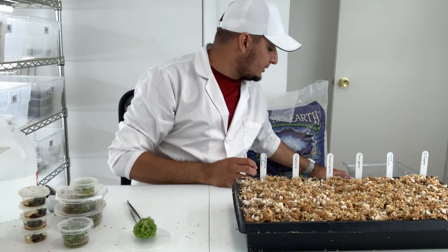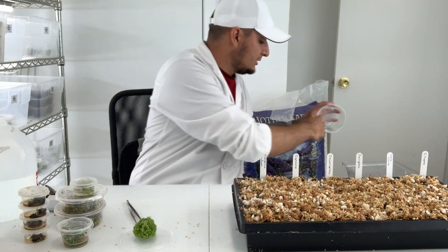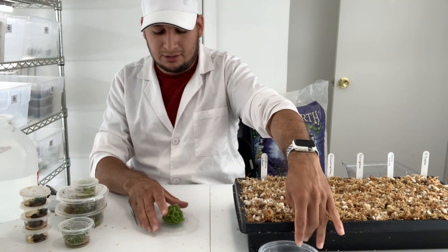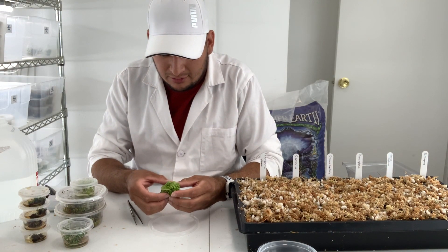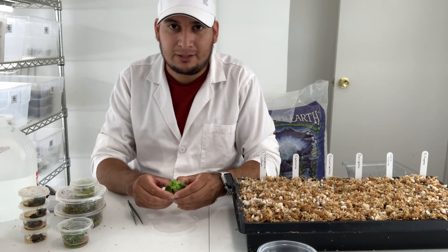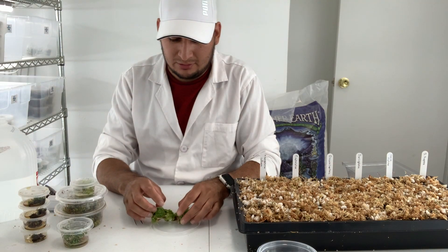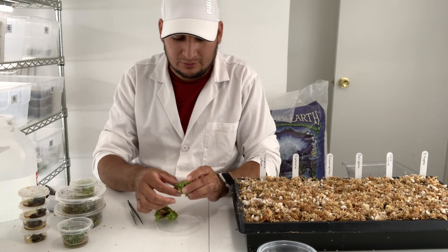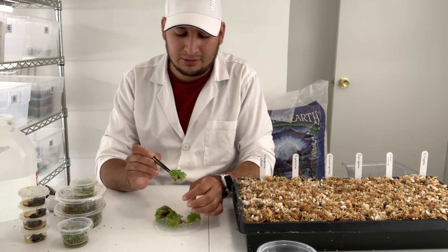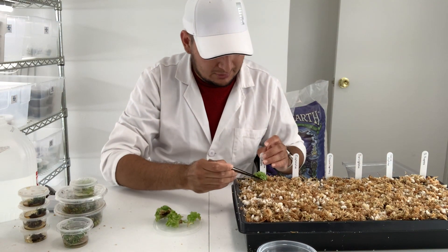I want to get rid of this gel and use the same container to rinse my other plants. I want to very carefully try to split the clumps — very gently. I need 12, so we'll see. I'm not going to break up every single plant; I just want to make small clumps. This is a very good plant to place in here.